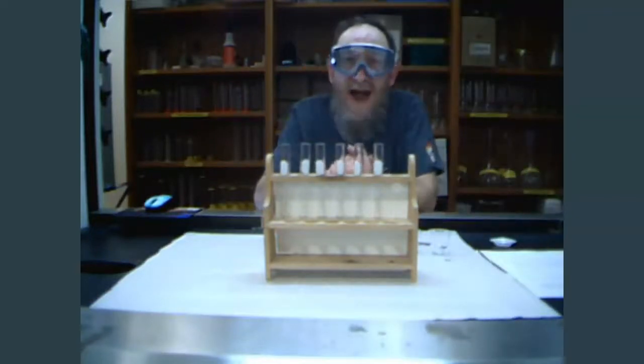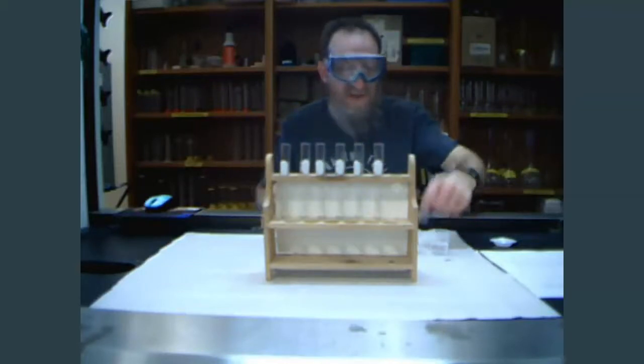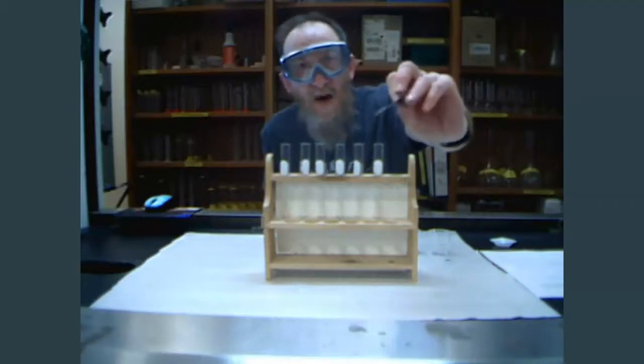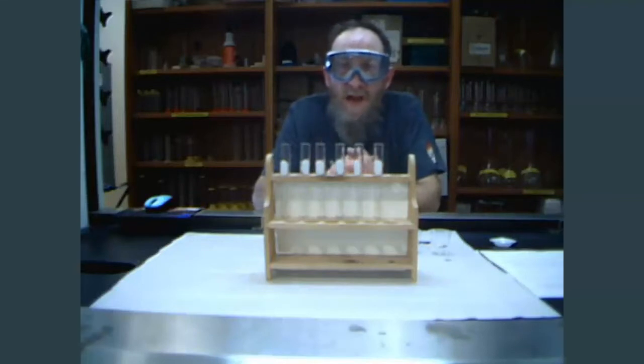All of these metals oxidize readily, which means that they react with oxygen. So what I did is I took some sandpaper and I cleaned off the lead, the zinc, and the copper, so that way I exposed the bare metal and it doesn't have to try to get through that oxide.